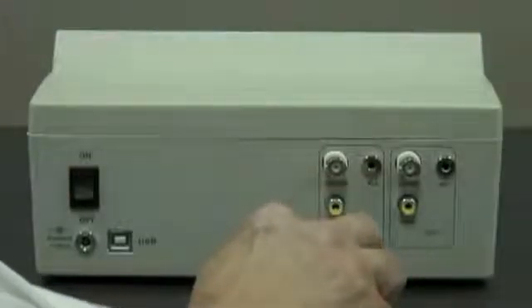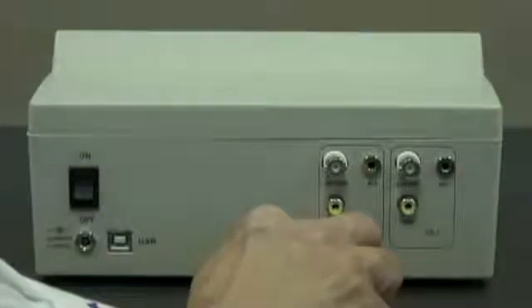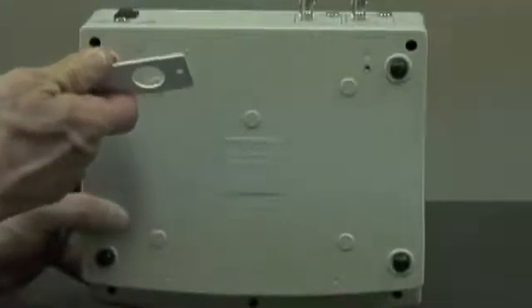Keep in mind that this is the HI-3222, which is a two-channel meter. We also offer the HI-3220 and HI-3221. In the case that you're using those meters, you would only see one channel. When I turn the meter upside down, I see two holes that are used for holding the mounting bracket for the probe holder.